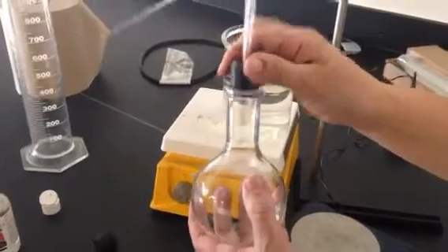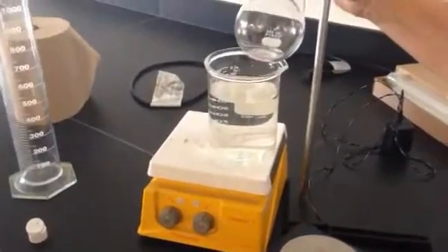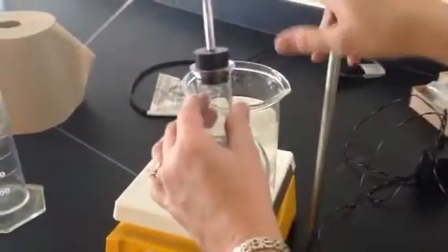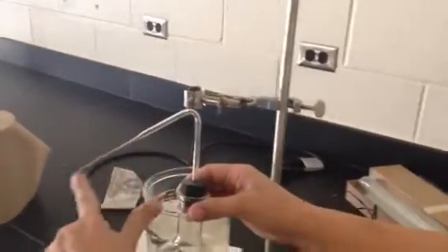So you're going to open this up and put a volatile liquid in there, and then you're going to put it in a hot water bath. Mine's not boiling, yours will be, or you won't get it very hot very fast. So you'll put it in there and you'll lower it as much as you can, holding it with a test tube clamp. That'll hold it in the water until you're sure no volatile liquid is still spitting out that opening.